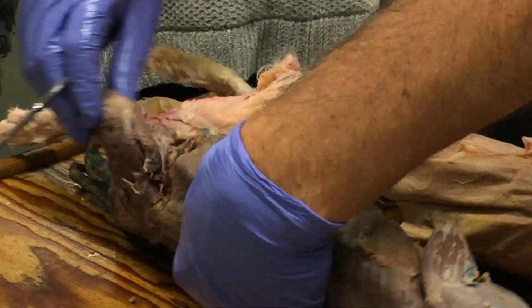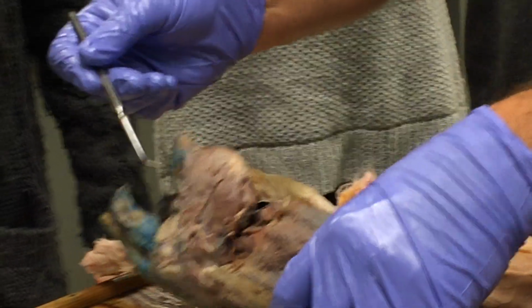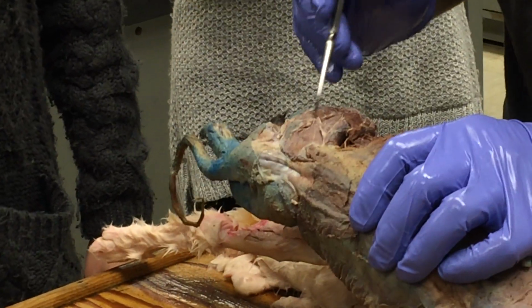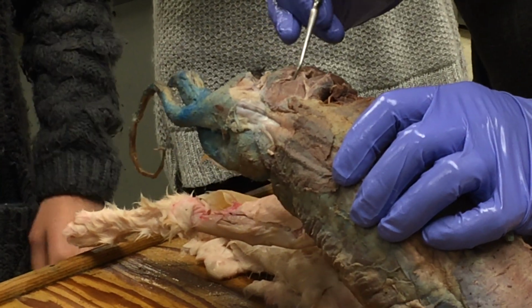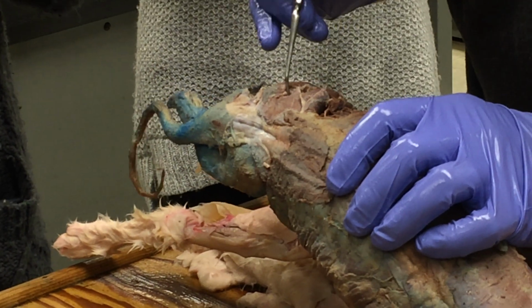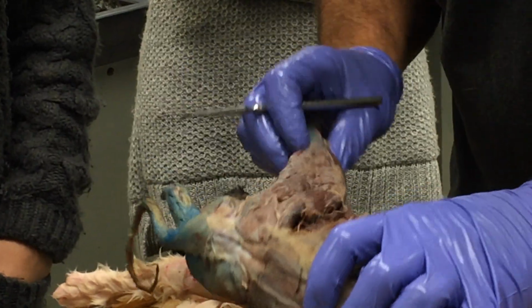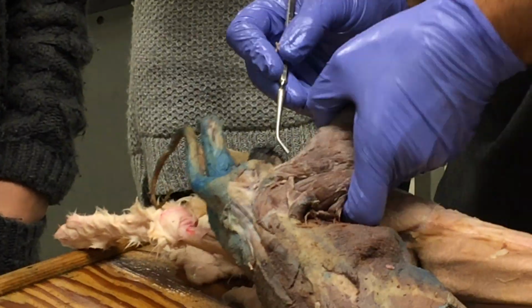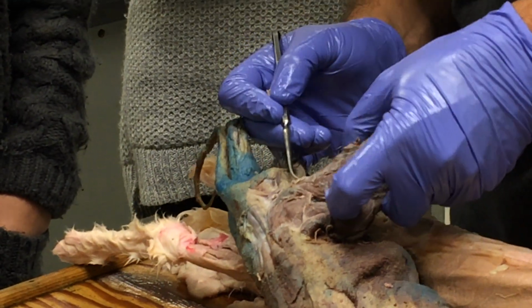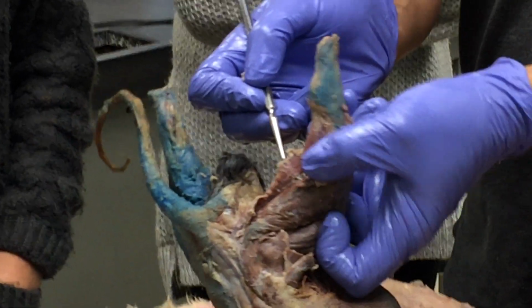Okay. And then the same thing on the mink. So here's again biceps femoris. The cauda femoralis, I think on the mink, is more or less non-existent. I don't really think they have a good cauda femoralis. I never found a good one in them. But they do have a good semitendinosus, and that's this muscle right here, semitendinosus.